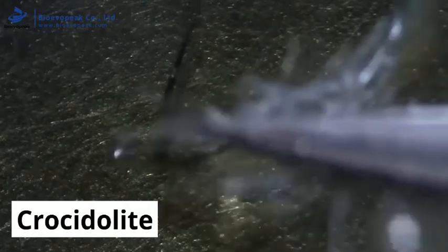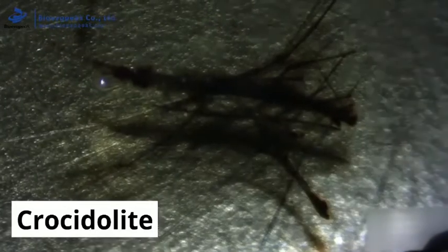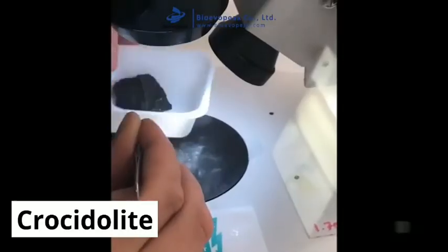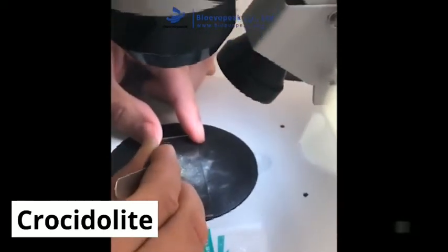The analyst places the prepared slide under the stereo binocular microscope and mounts multiple suspect fibres by lowering them into the liquid. After this, a cover slip is placed over the slide, and the slide can be brought out of the dust cabinet. The slide is placed under the polarized light microscope, and the process repeated.